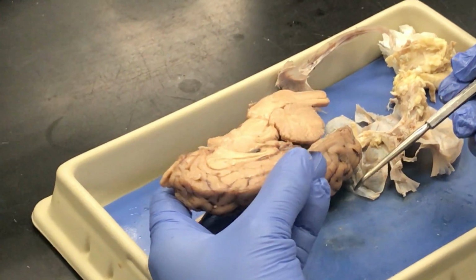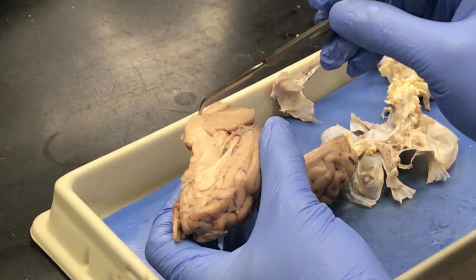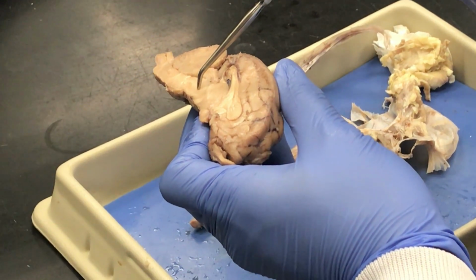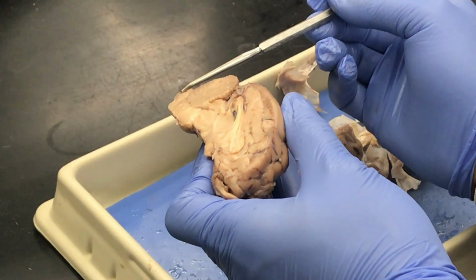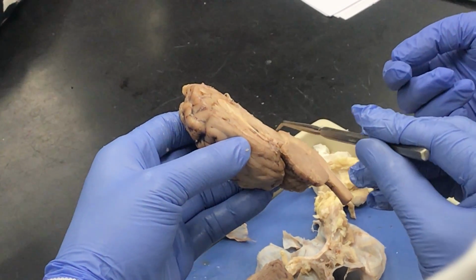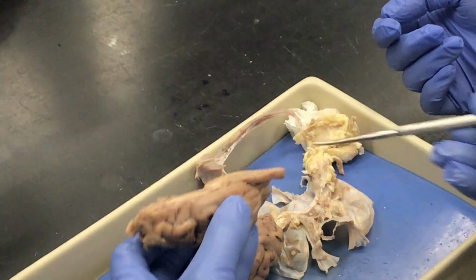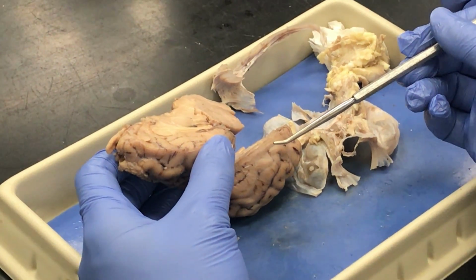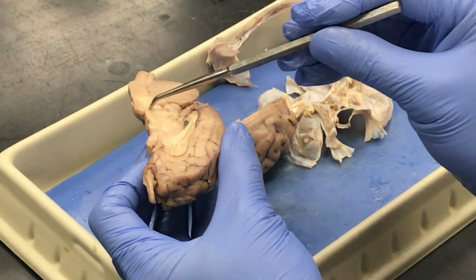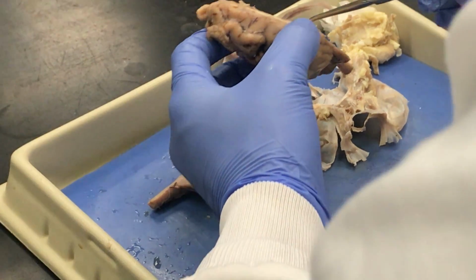Then the medulla oblongata. Medulla oblongata, anterior to the cerebellum, so we're now at this portion. Just to keep track, we had cerebral peduncle, pons, and then medulla oblongata. Down here, we're seeing a bit of spinal cord. So cerebral peduncles in the midbrain, the bump is the pons, medulla oblongata, and spinal cord. The basilar artery, that's another skip.